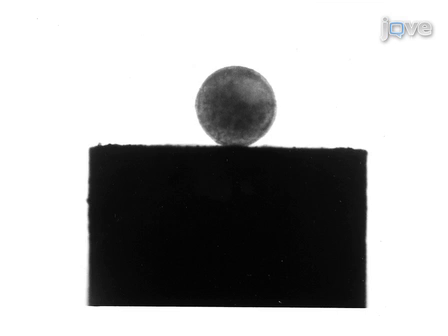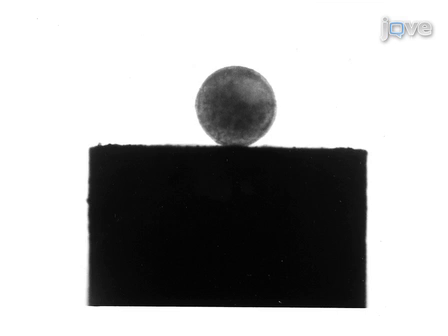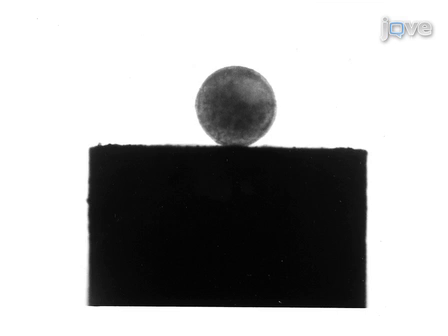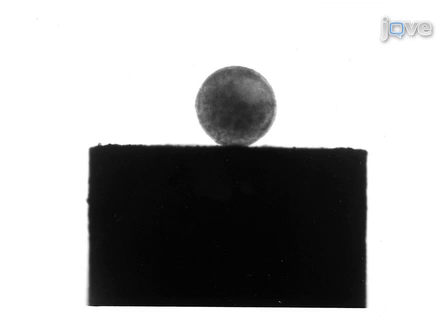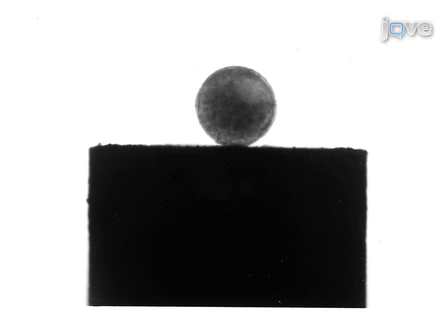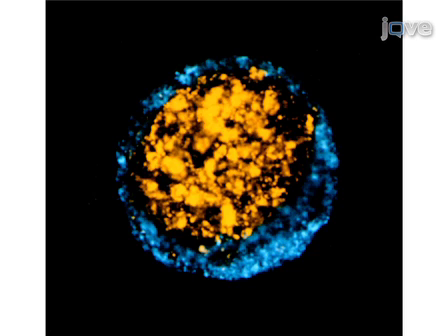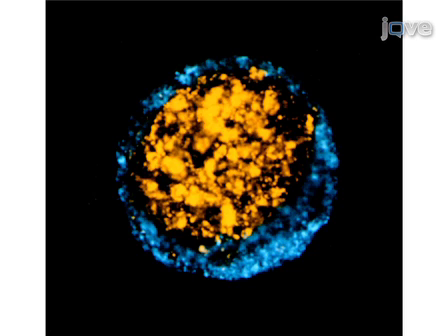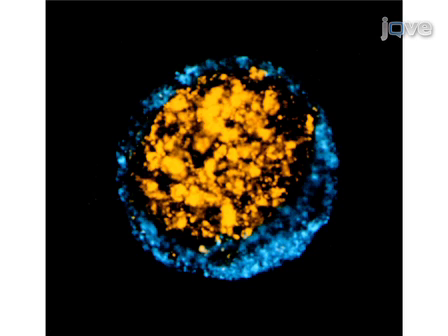This image was captured using a Nikon SMZ800 stereomicroscope and illustrates a spheroid formed by incubating chick embryonic liver cells in hanging drop culture for 18 hours, then in a 37°C shaking water bath for 48 hours. This confocal microscope image demonstrates the sorting out behaviour that occurs when certain cell populations are co-cultured using the hanging drop method.